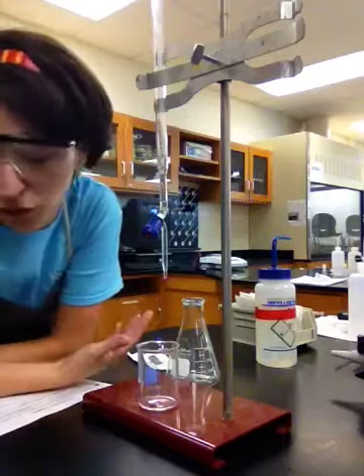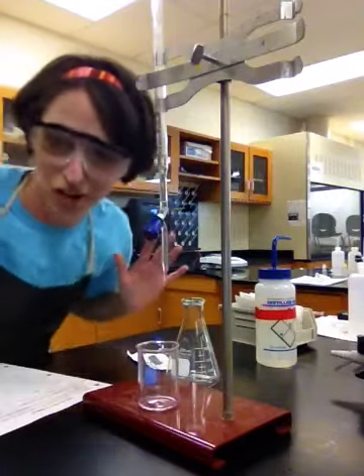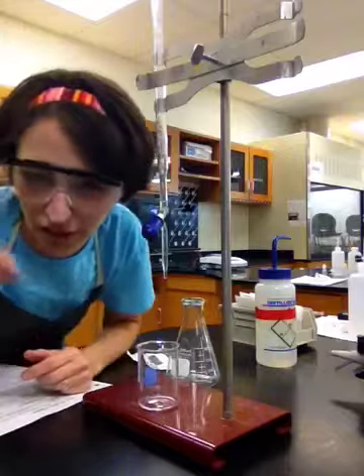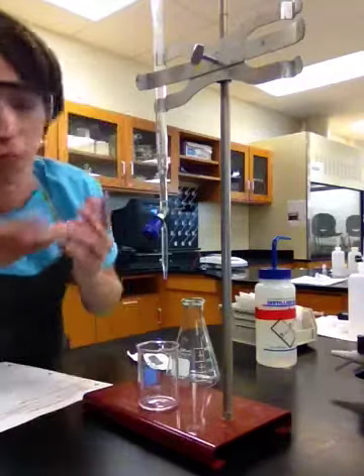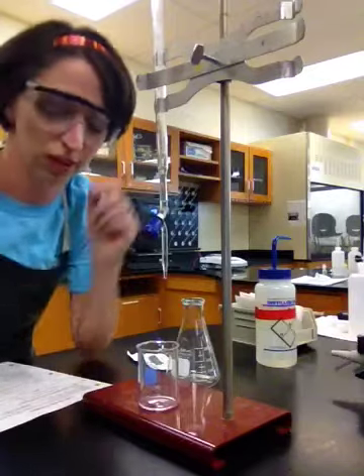All right, I told you guys I was going to be absent today, but look, I'm here. So I know this is kind of weird, and this is going to be a very low quality video, but I really wanted you guys to be exposed to what the lab process looks like for a titration.